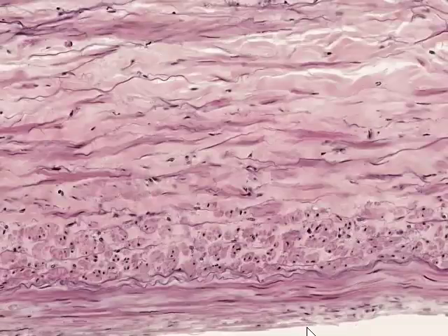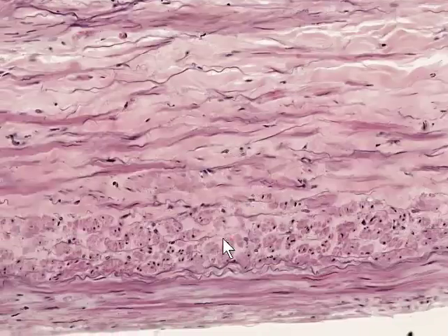At higher magnification we see the surface on which the endothelial cells would be found. There's an endothelial cell nucleus here and here. Beneath that we can see the connective tissue, fairly loose, uncompacted connective tissue initially of the tunica intima, followed by denser, more compacted connective tissue with these elongated fibroblast nuclei compressed between plates of collagenous material, followed by the internal elastic lamina at the tip of the pointer here, and then, as I mentioned, this internal layer of longitudinally oriented smooth muscle, which means that here it's going to be cut in cross-section.